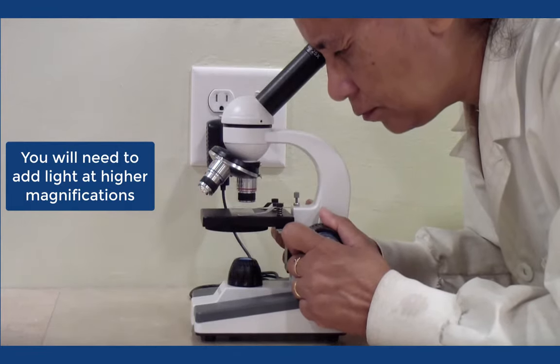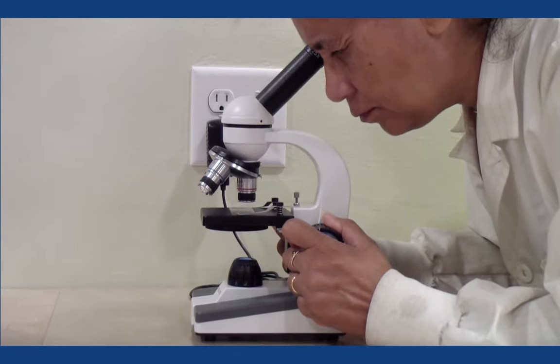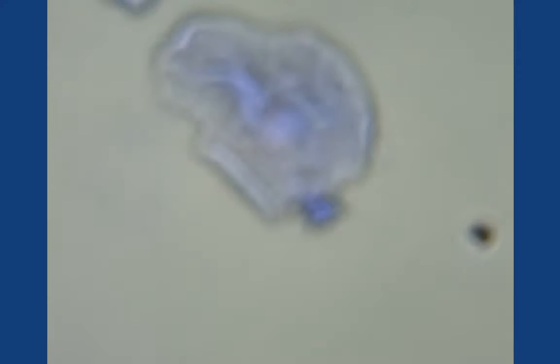You may have to move the slide around a bit until you can see your cheek cells. They will appear as round or oval purple shapes. Once the slide is in focus, move to the 10x objective and refocus only with the fine focus knob. Then move it to the 40x objective and only use the fine focus again.